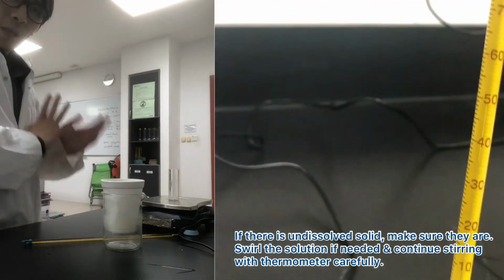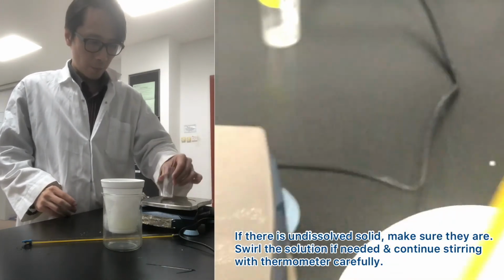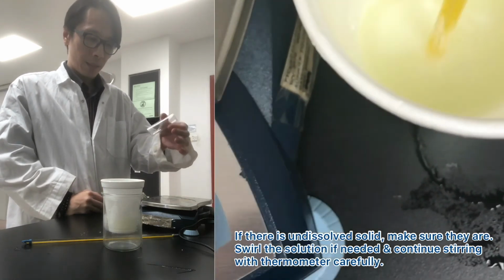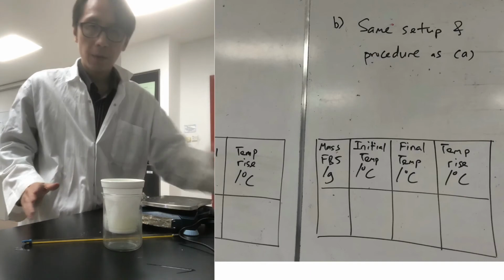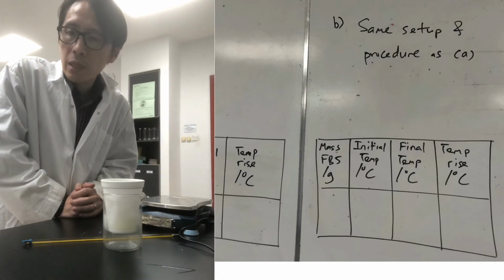So record this in the table, and you will have a set of values. Oh, just to verify. 13.5, so I have to subtract that to get the mass, which is again about 2.0 grams. Okay, so that's the experimental procedure part of this question.